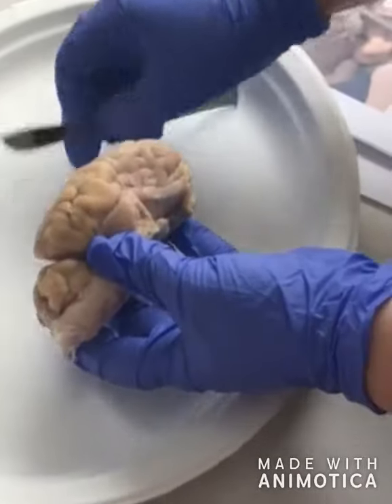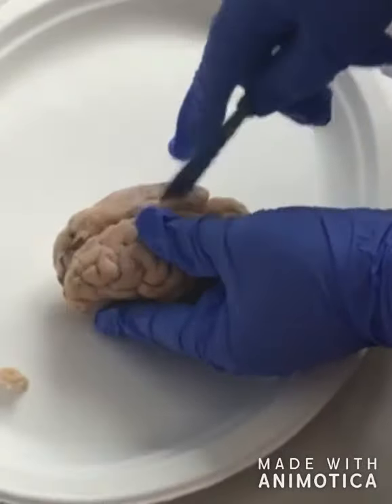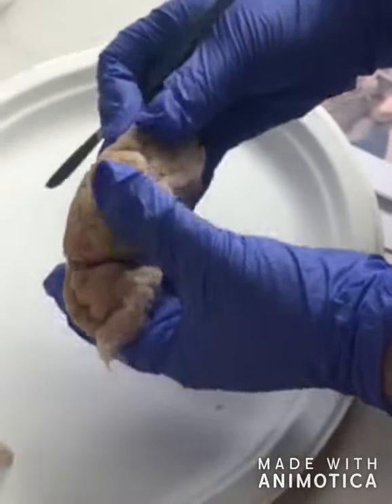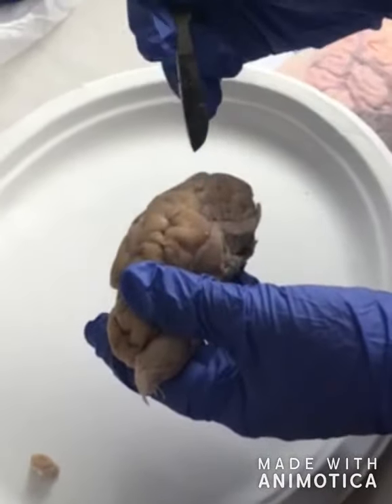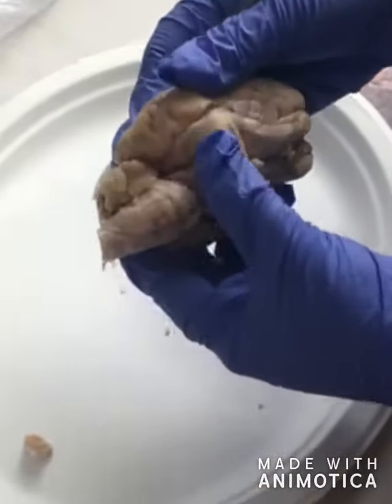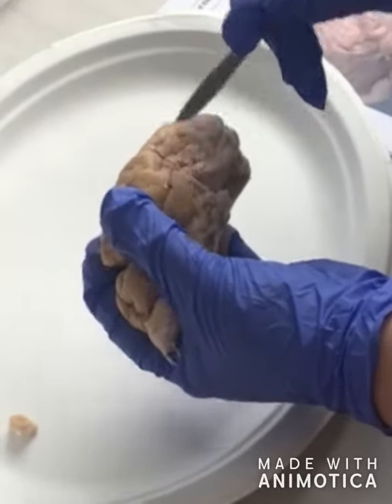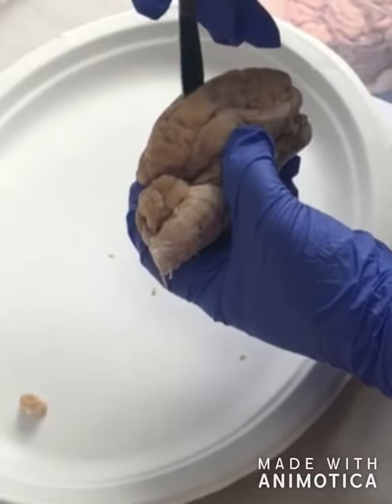So now we're going to talk about fissures. The medial longitudinal fissure is really just going down the middle of the two hemispheres. It separates them. And then we have a central sulcus, which separates the parietal and the frontal lobe, which is this right here. And then we have the lateral fissure, which is right here. It's a horizontal groove between the temporal, which is right here, and the parietal lobe.